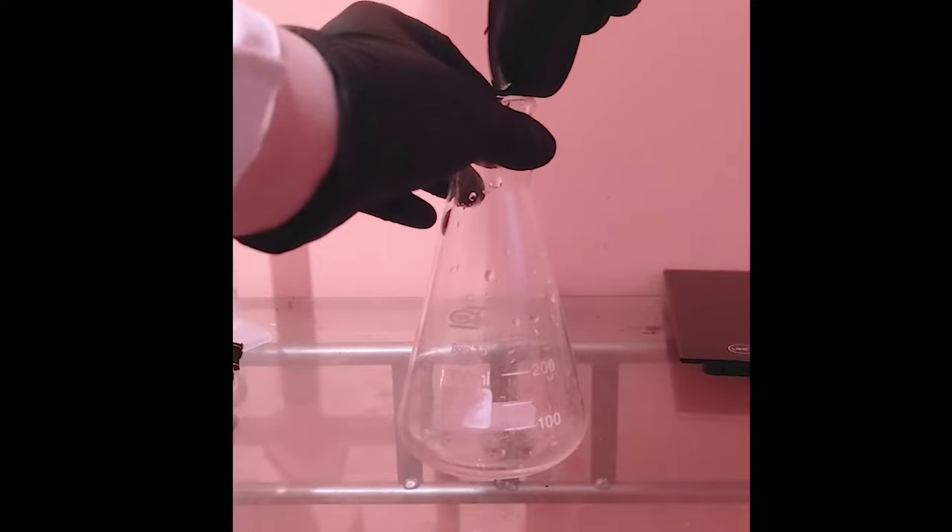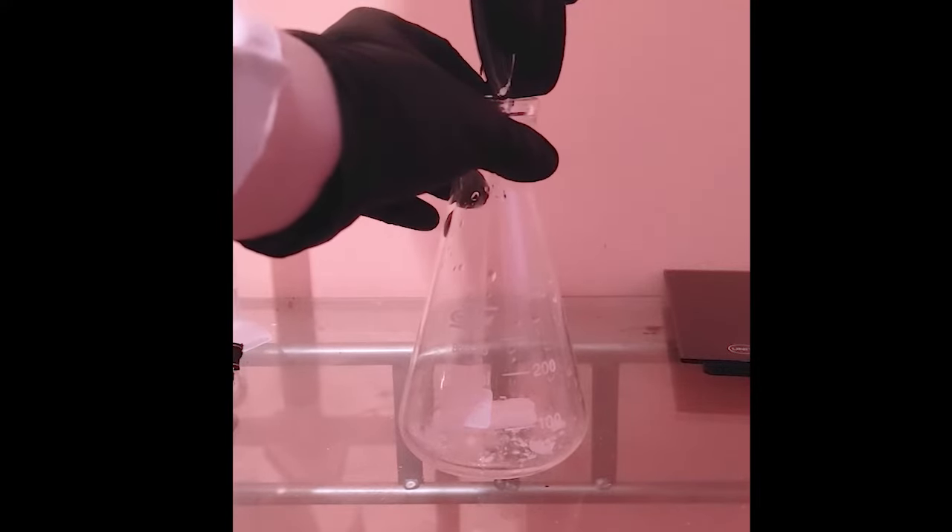As you can see, I have this really cool plastic, which was made from a toxic liquid and a toxic white powder. I love organic chemistry.